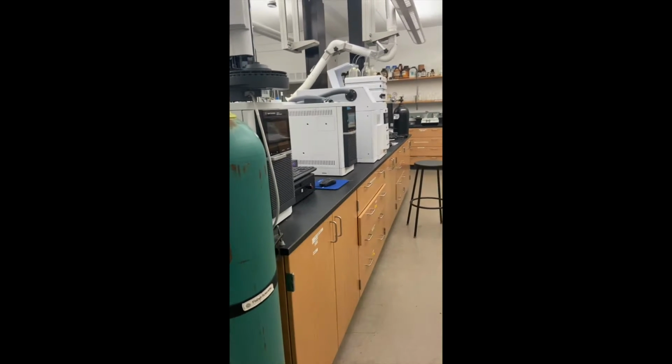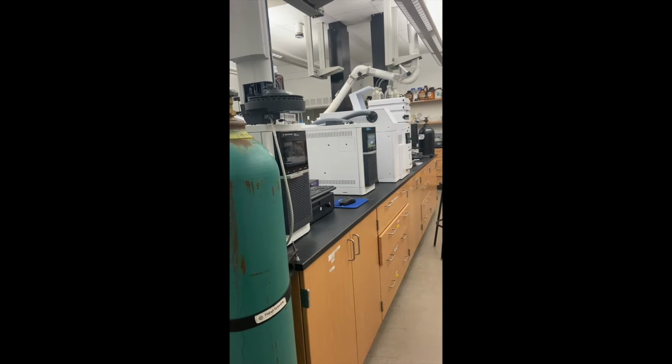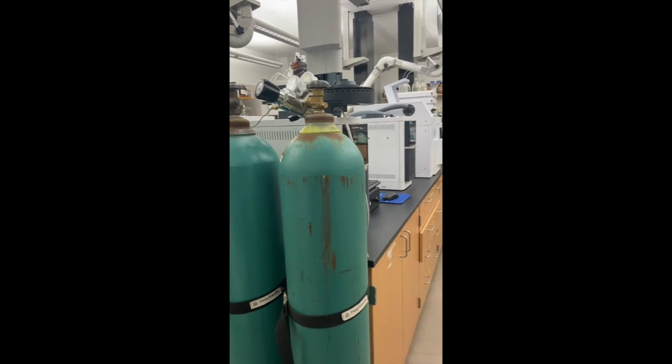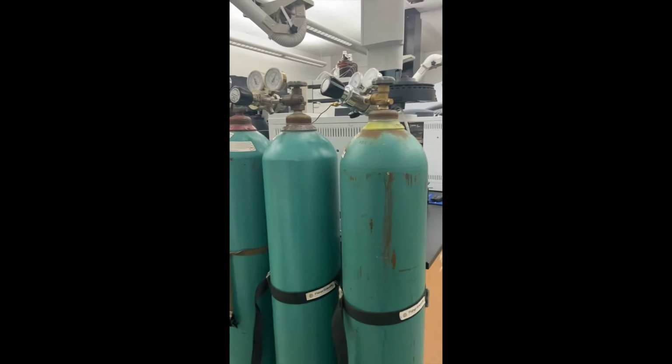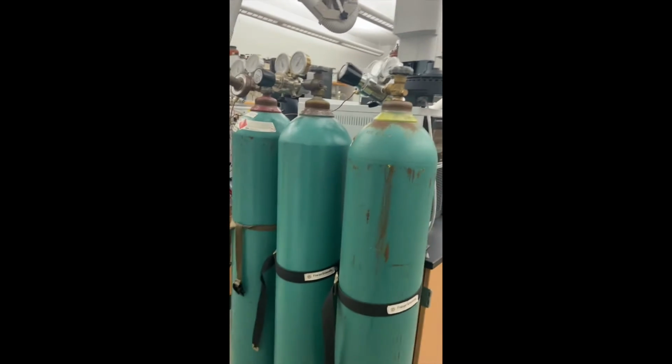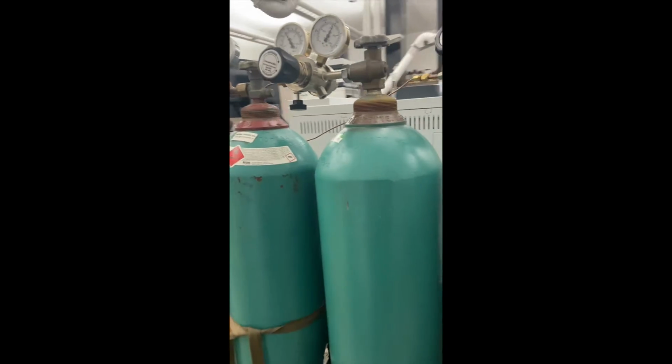Hey guys, I'm going to be showing you how to turn on your GC headspace systems. So you will not have to do any of these initial steps. This is just for your information if you were to do it alone. Okay, so first things first, we would turn on our gases.